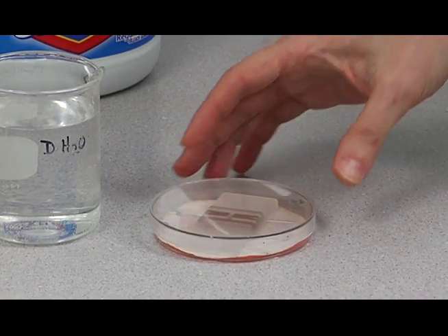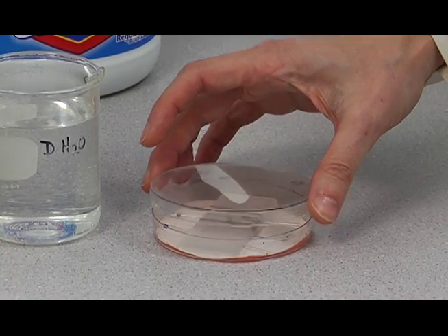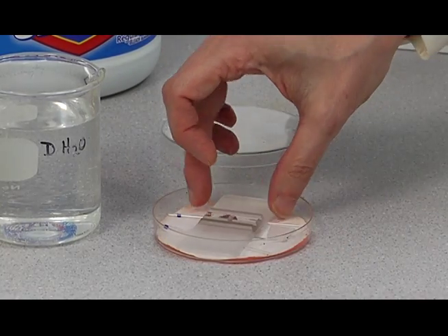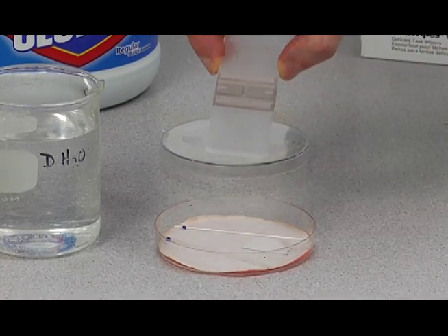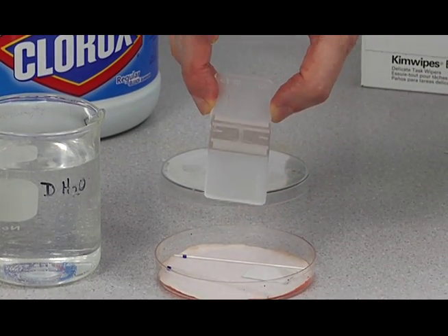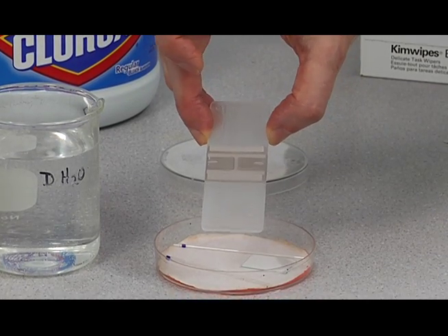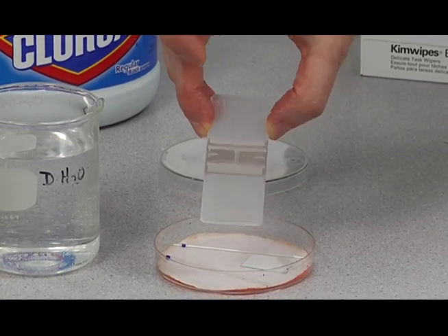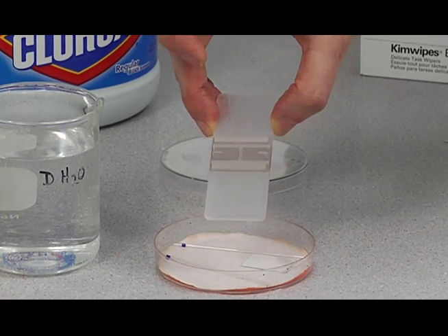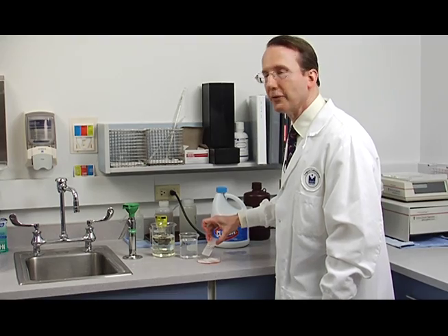Take off the cover of the petri dish. And here's the hemocytometer. I check it very carefully to see if there's any film or residue or debris on it. And even if I don't see any, I still wash it because there's often material on there that you can't see that will throw off your platelet counts quite a bit.